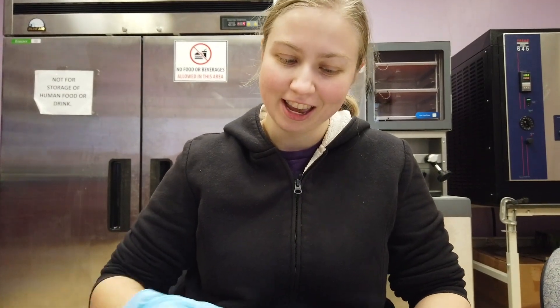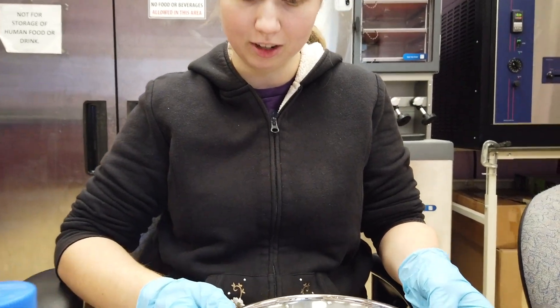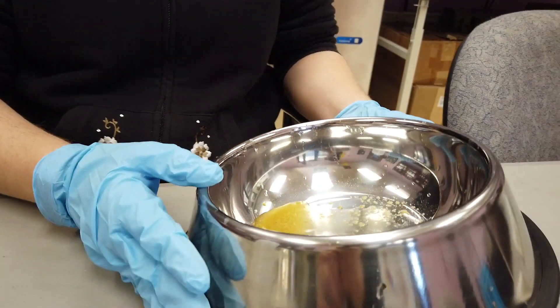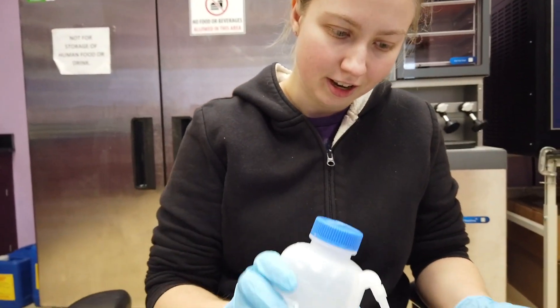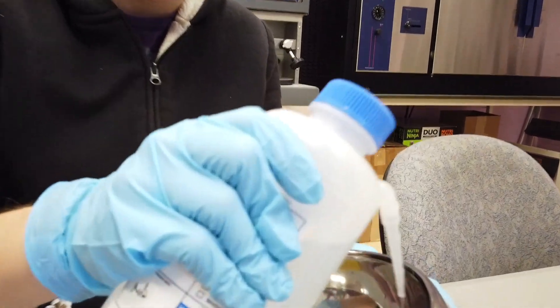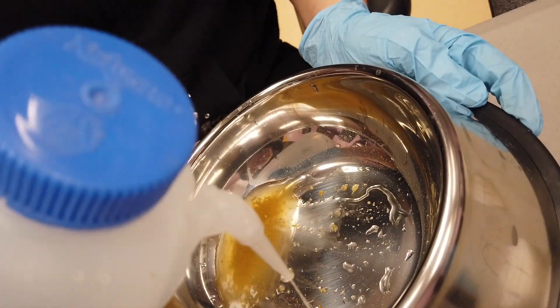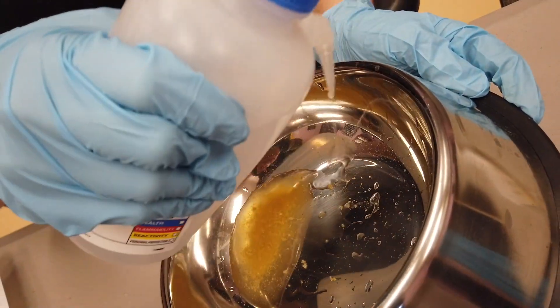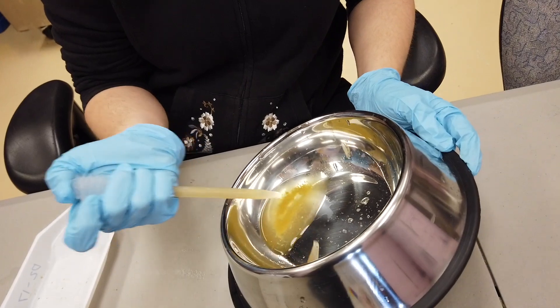So basically what I'm doing is we have the feces that were collected in this dog bowl and I'm going to tilt it so that it all collects in one area. I'm going to use this distilled water and spray all the feces down into that pile of water at the bottom for easier collection. Then I take this and use it to suck up all the feces.